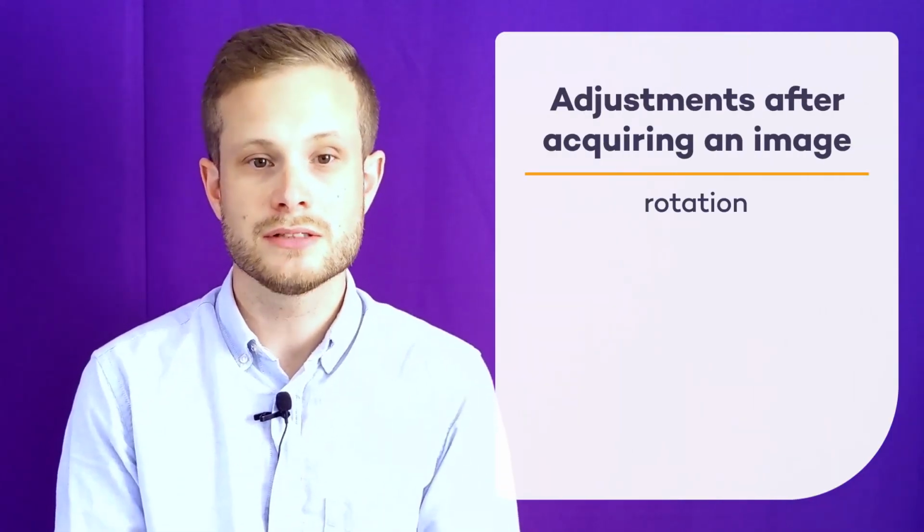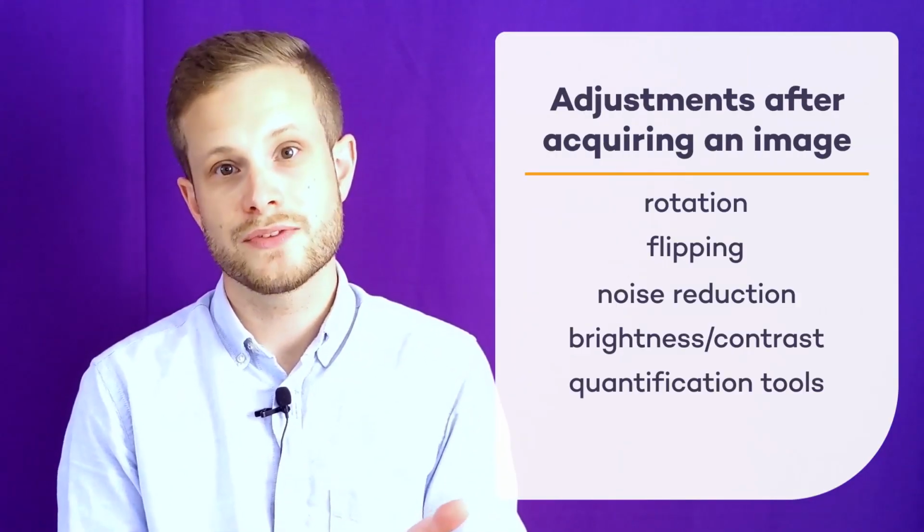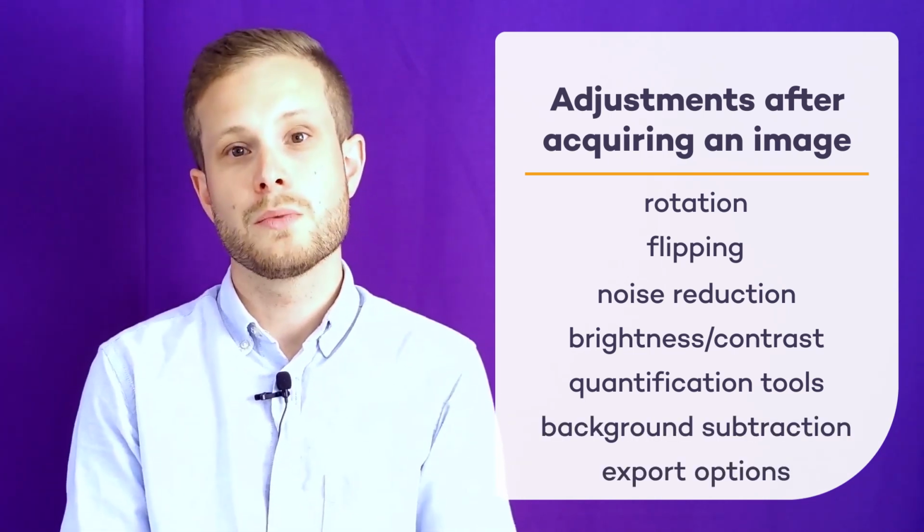There are several adjustments that you can apply to your images after they've been acquired, and some software tools and options that can affect your data when they're used. These include rotation, flipping, noise reduction, brightness and contrast changes, quantification tools, background subtraction, and export options. We'll discuss these factors in this lesson.